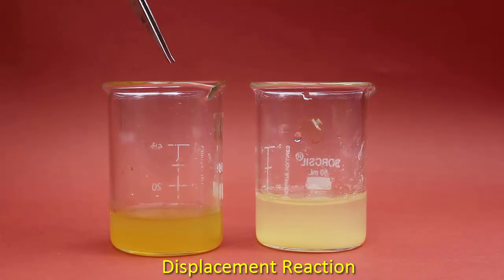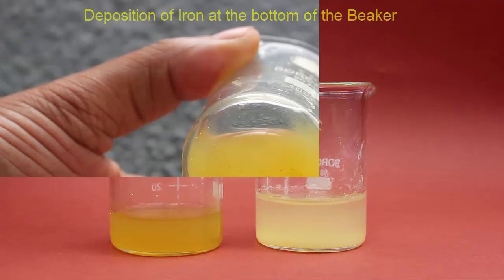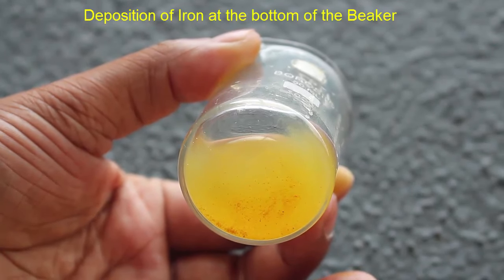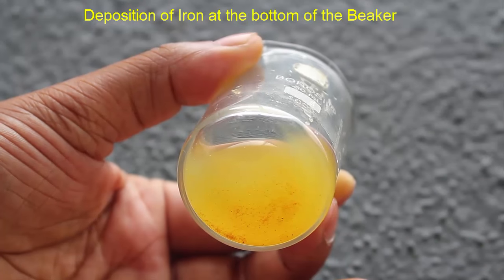Where a metal displaces another metal. Now we can see the deposition of iron at the bottom of the beaker. Called the displacement reaction.